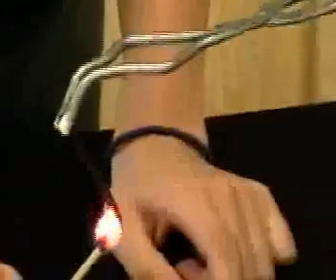Your reaction — it's not doing anything. You have to really rub. When you actually... oh, I see some shiny. It's good. Be sure you're covering your eyes — cover your eyes now. You might want to move that match. Put it in here. That was awesome.